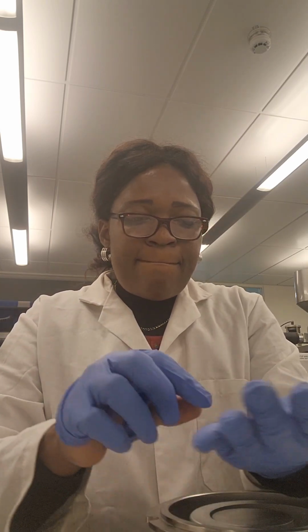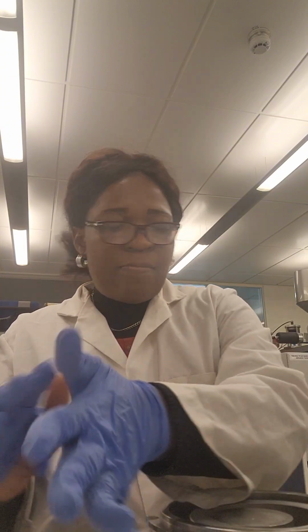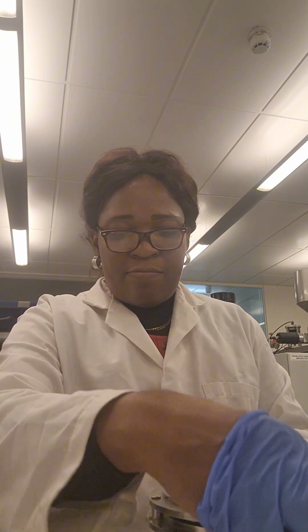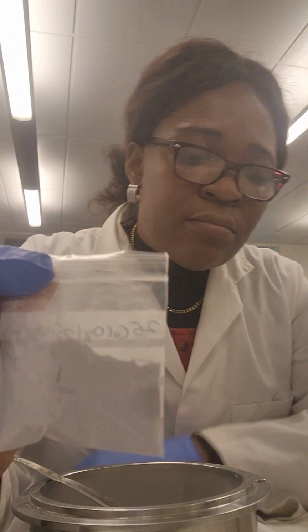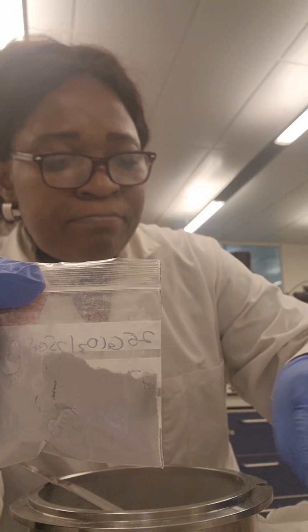So if you want the bubbles out and you really need a very clear glass, you should let it stay longer in the furnace. But at this point, a lot of redox balances, a lot of bubble removal would have taken place. So I just milled it and got them ready for further experimentation, just to say cheers to what we do, cheers to my day-to-day work, cheers to science, cheers to research, cheers to experimentation, and trying to bring something new into the glass industry.